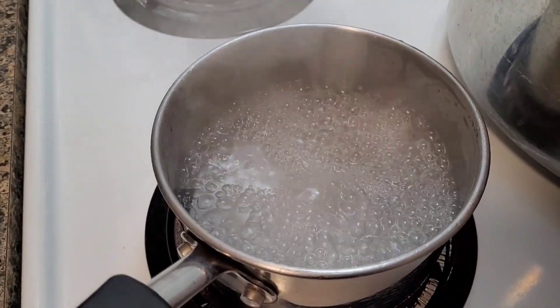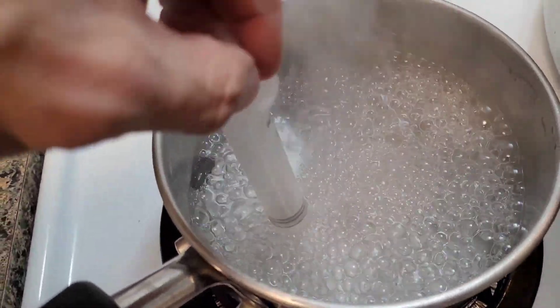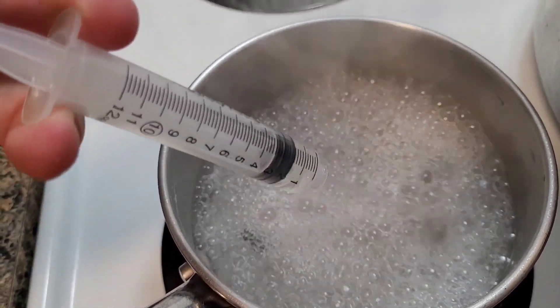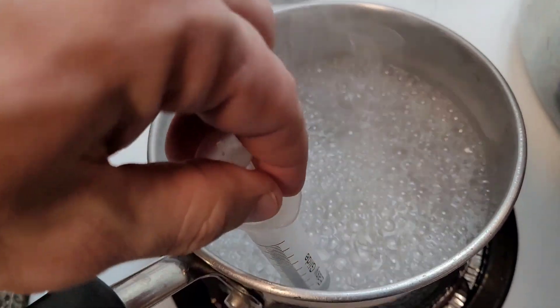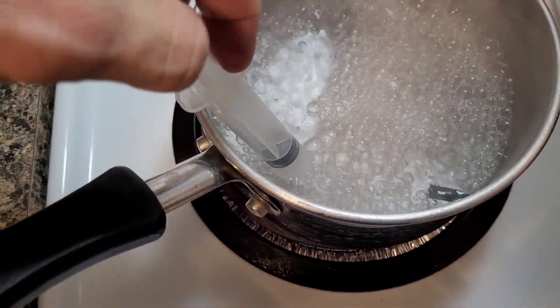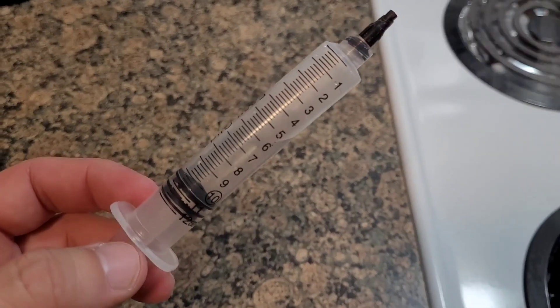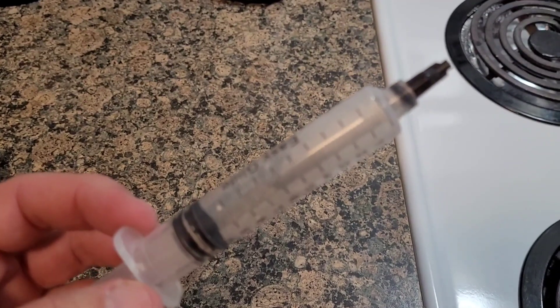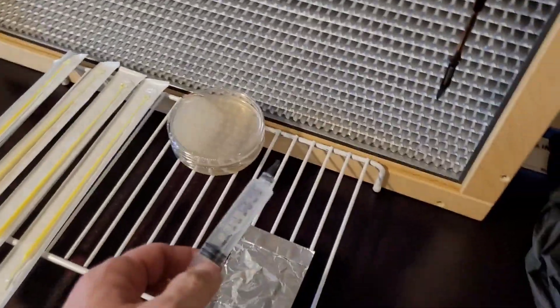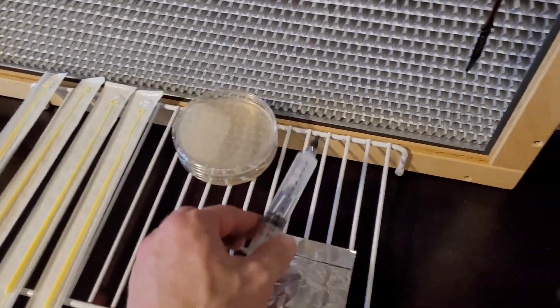So it's been 15 minutes. Now all I'm going to do is just suck some water in and out of here. Once it's full of water, just put your cap on it. You don't need a full 10ccs — you just need enough water in there to do your streaking with. Bring your syringe over to your workstation, whether it be a flow hood or a still air box, and allow it to cool down.